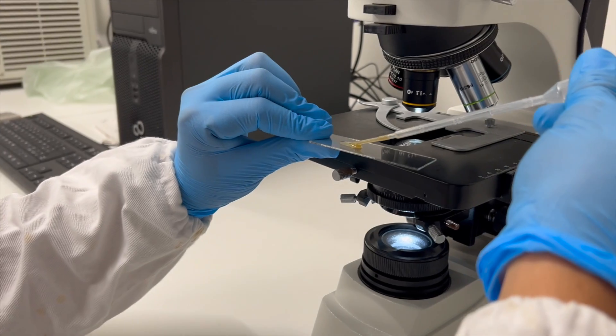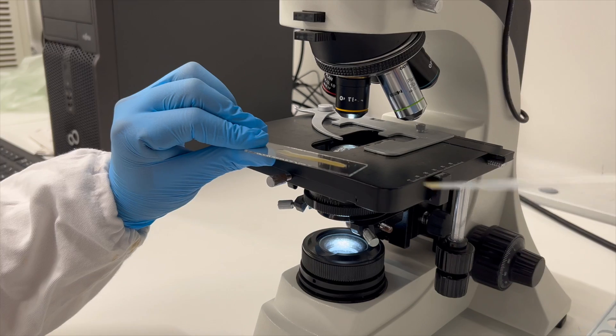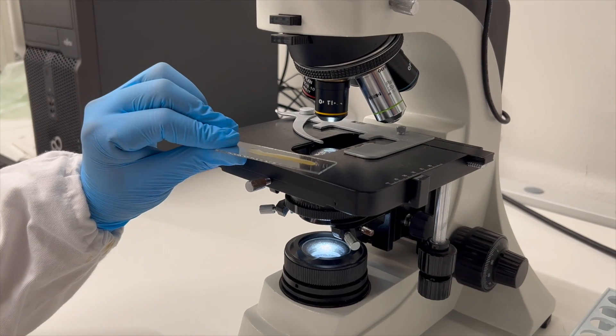Place a drop of the sediment, about 50 microliters, on a microscope slide and cover it with a coverslip. Then examine it under a compound light microscope.